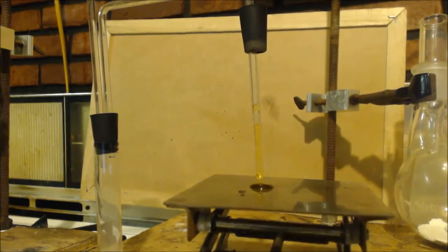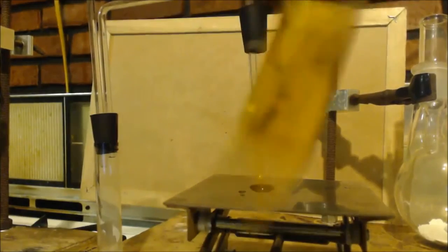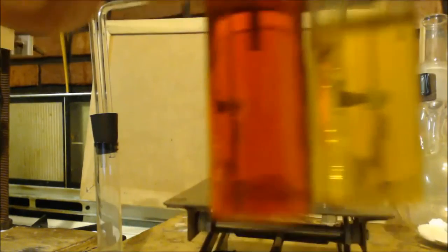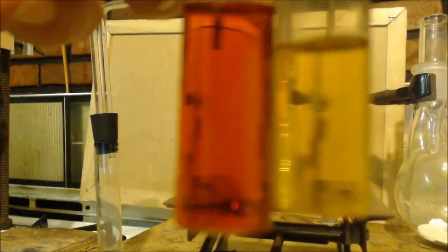Well, it's not clear enough. But I'll tell you why. It's because I put too much bromine in there, man. I put too much of it. Because look at the difference, though. It did take some of the bromine away. Look at that. I mean, that's almost clear, compared. See, there's the liquid that came over. Should have put that in an ice bath. At the very end, there was a little bit of the alcohol coming over.